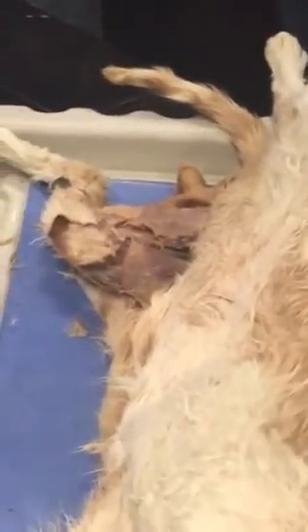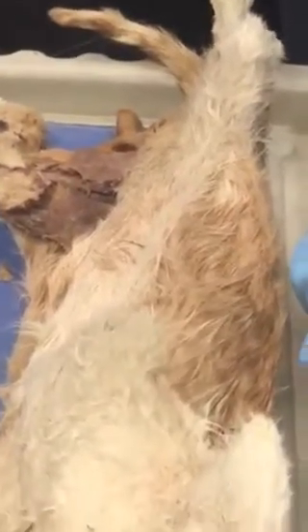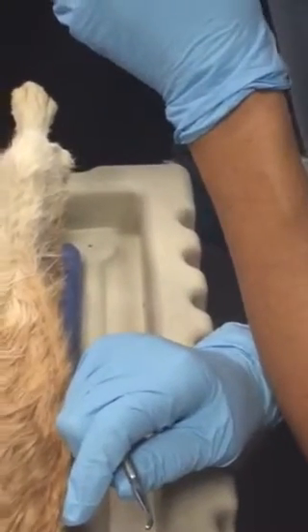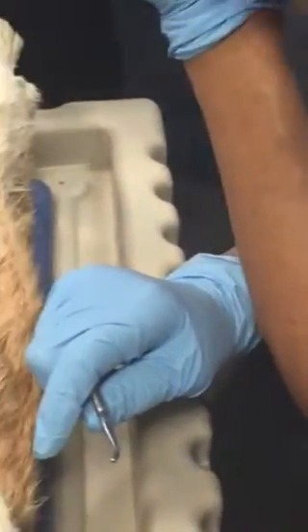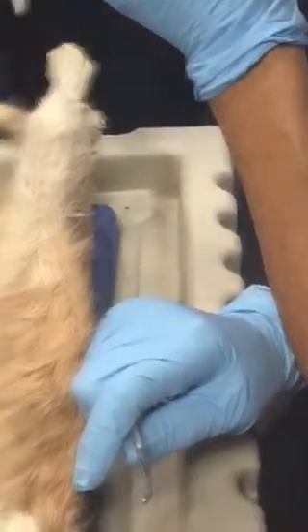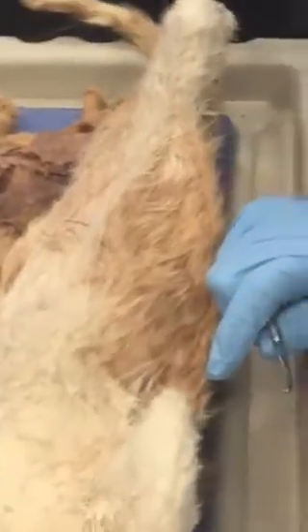And in humans, there are two. What are those, in humans? On the model, take a look at that model. Can someone rotate it? Rotate it a little bit, like 15 degrees more. Yes, do you see those two? Sartorius and gracilis. Okay, gracilis is there.